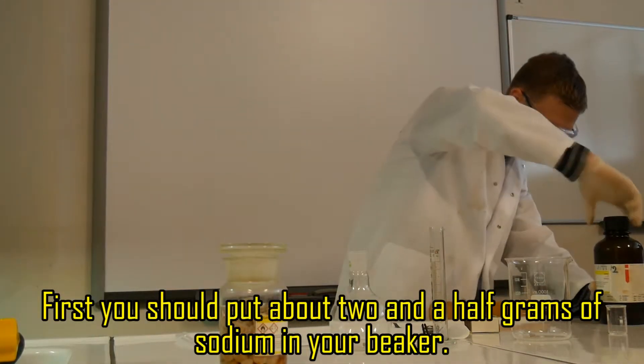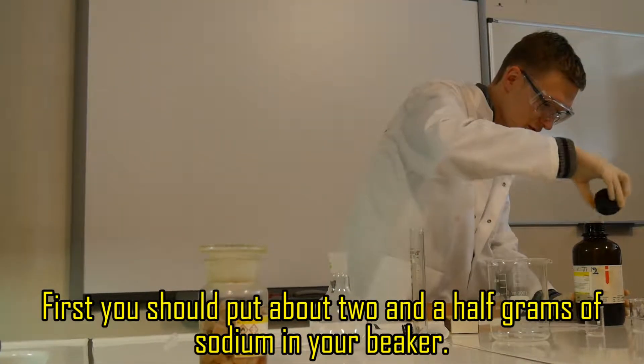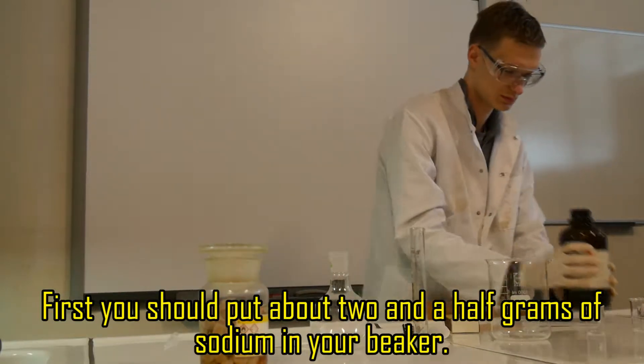First you should put about 2 and a half grams of sodium in your beaker.